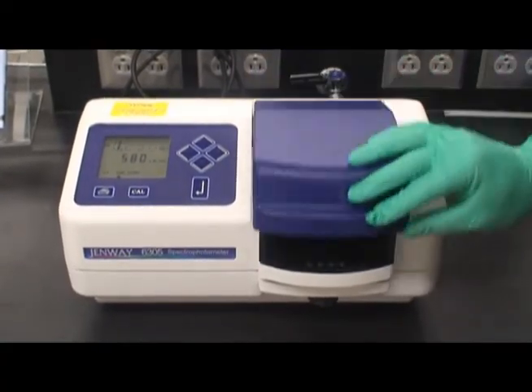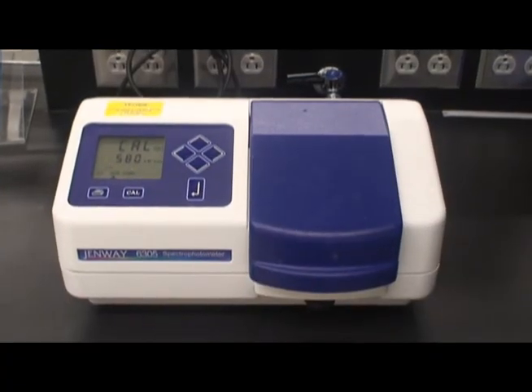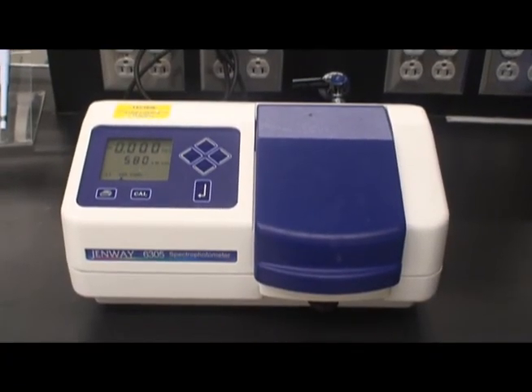After placing the cuvette in the holder, close the lid and press the calibrate button. Do not remove the cuvette until the absorption reads zero.